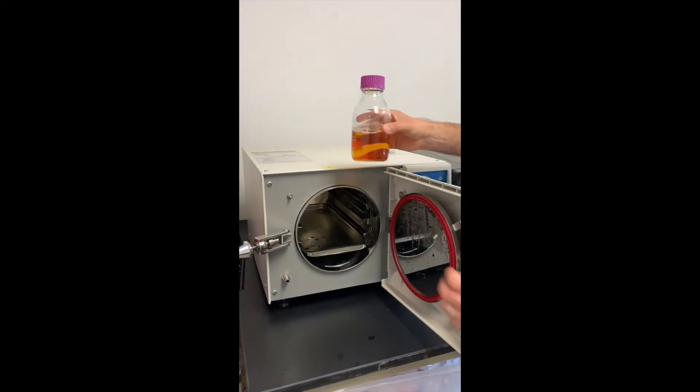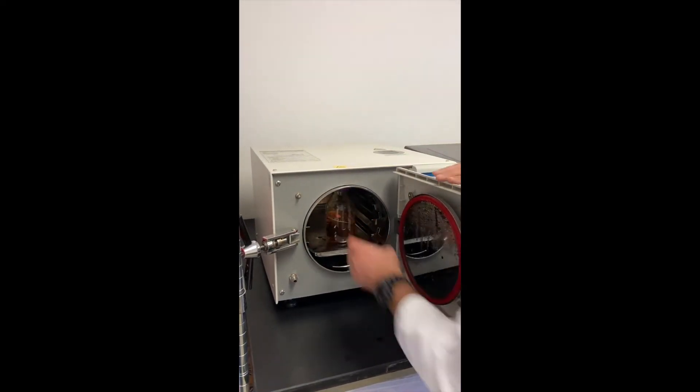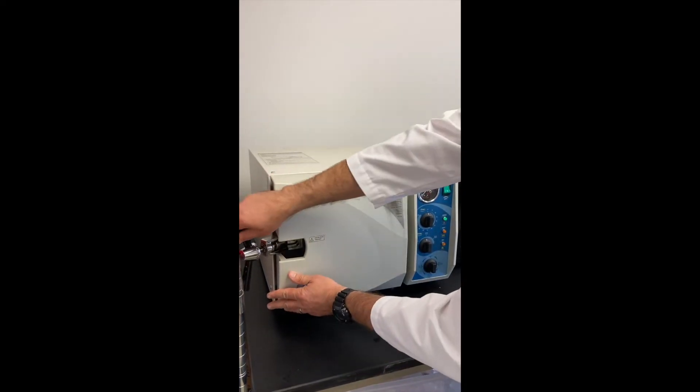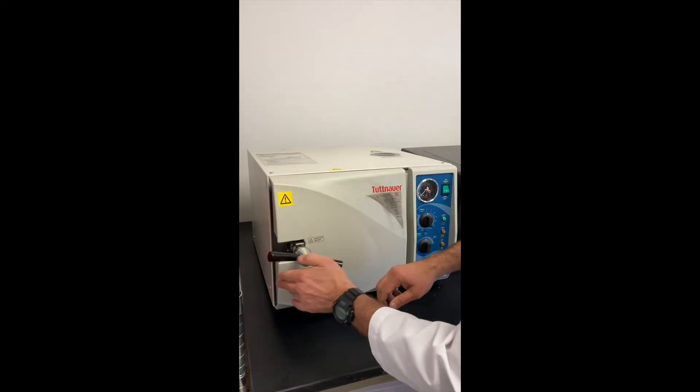Next, we put this in the autoclave to sterilize the liquid. The very high temperatures kill any microorganisms we don't want in our plates.